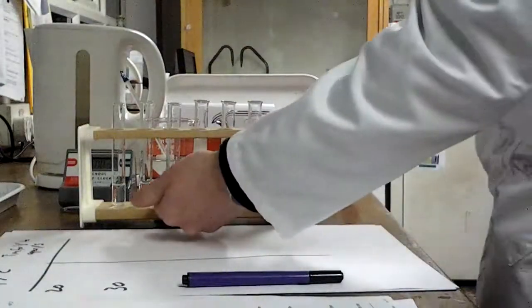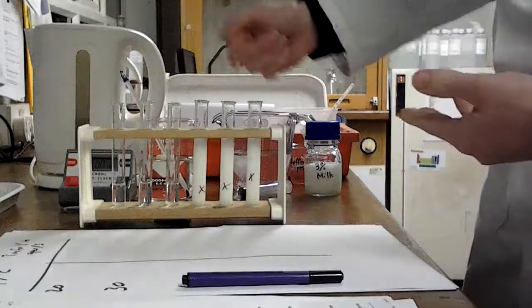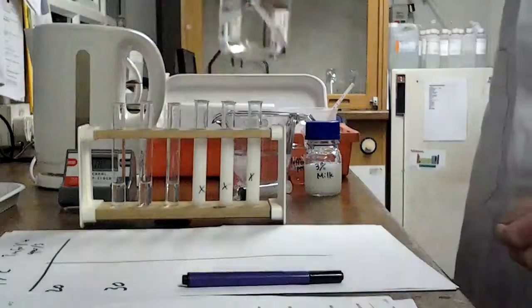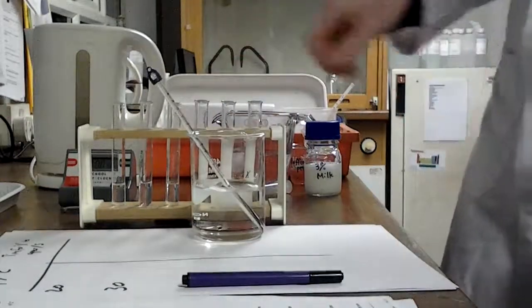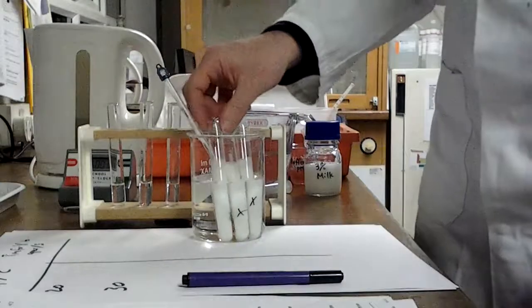substrate and buffered enzyme ready to go. So we've obviously got enough for 3 experiments. Those are our repeats right there. Time to get our water bath back. Still at 20 degrees, you'll be pleased to know. And what we're going to do is we're going to put all 6 tubes in there.